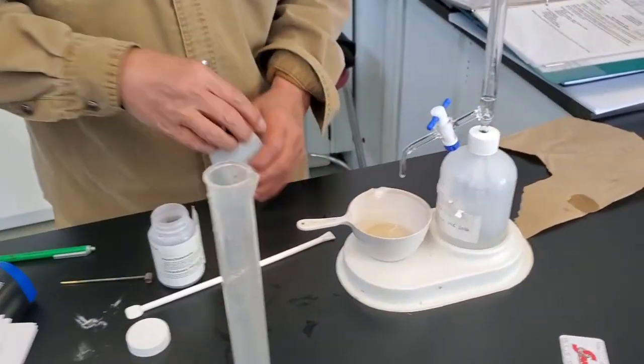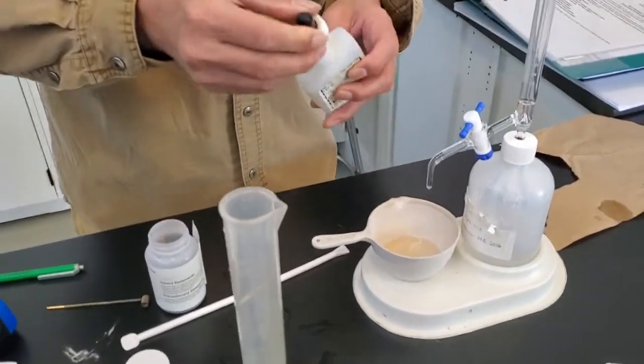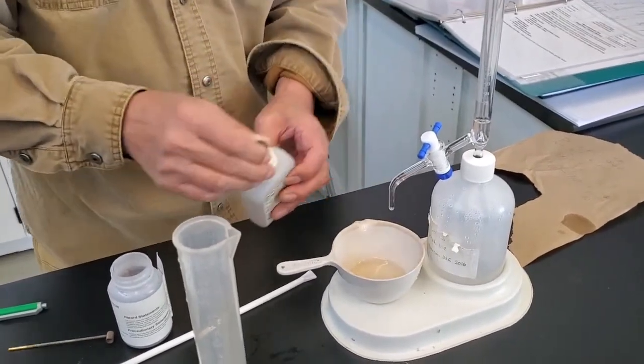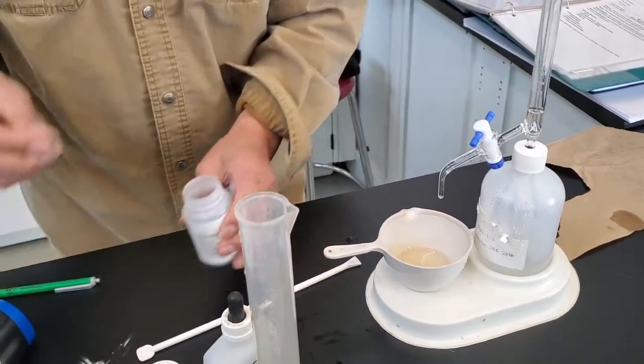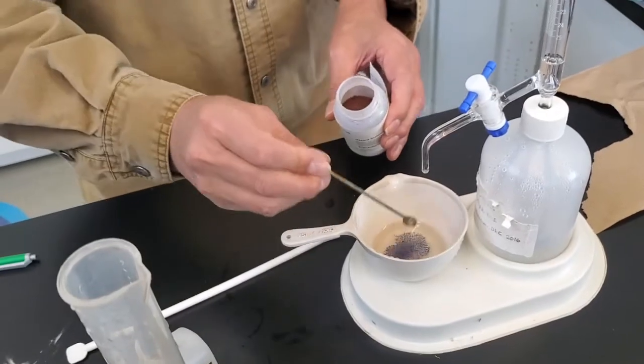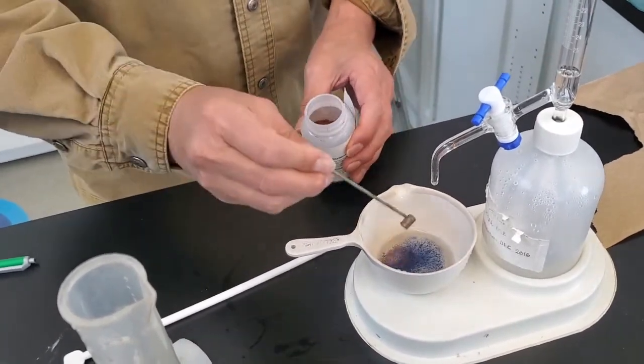Okay, and I'm going to put some hardness buffer. That's a hardness buffer solution. And I'm going to put some indicator. Now, see the color change. Okay, one, two.